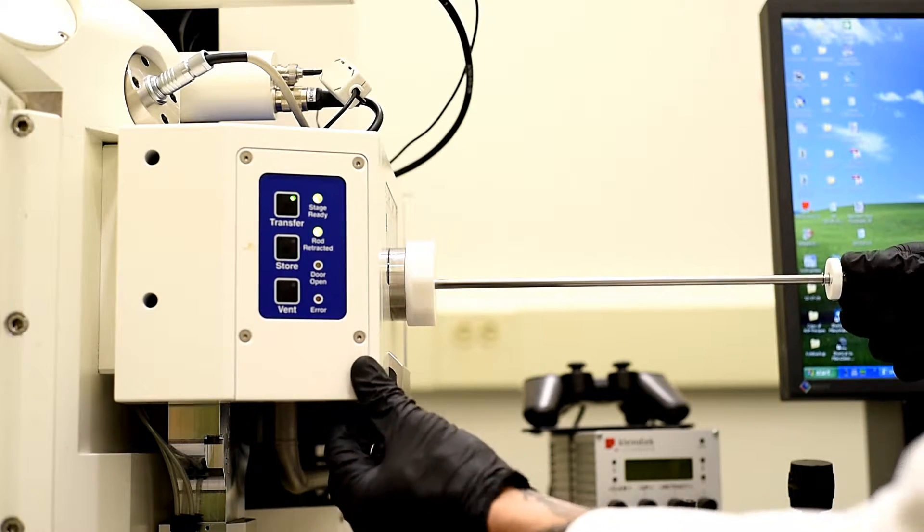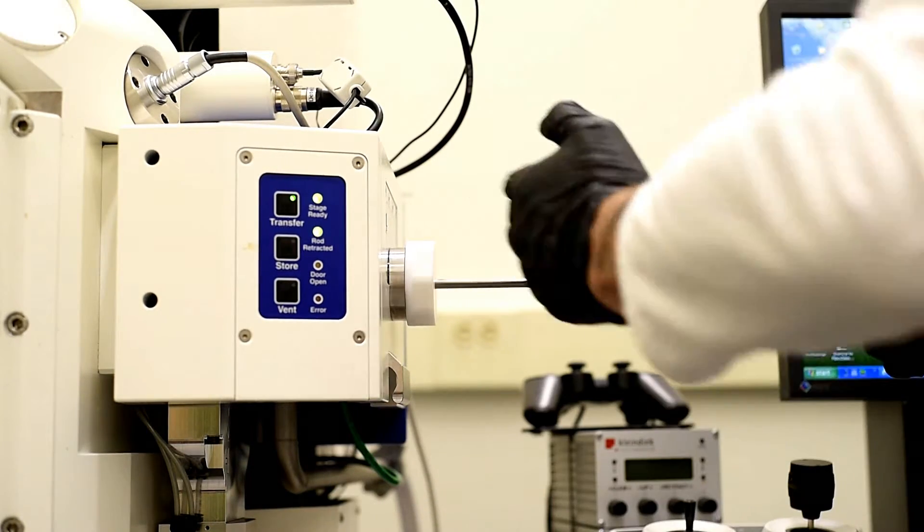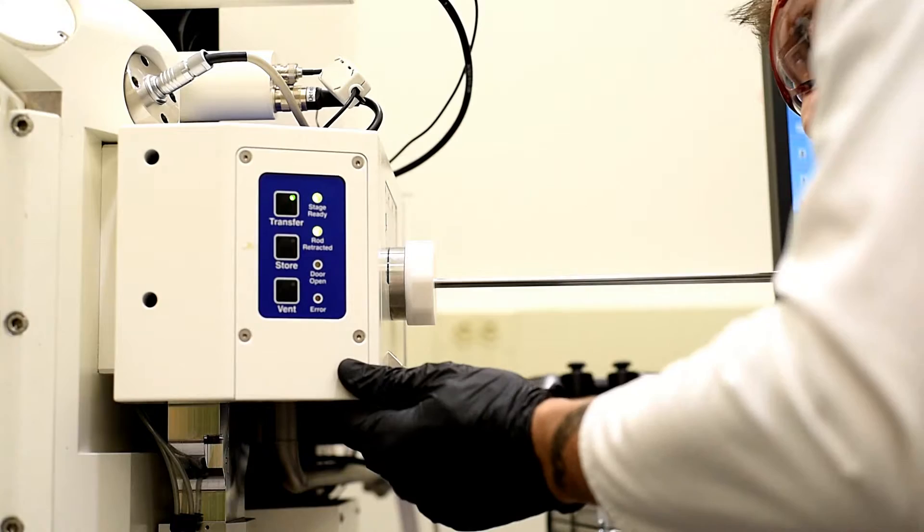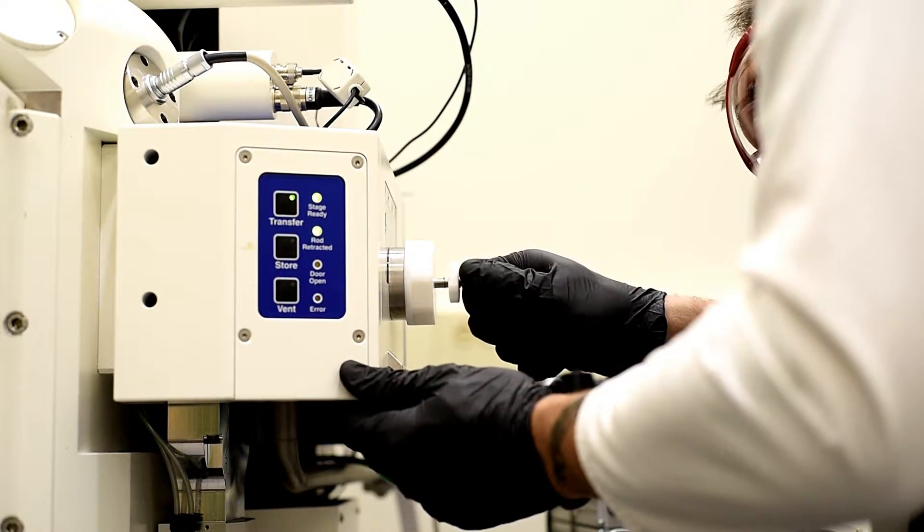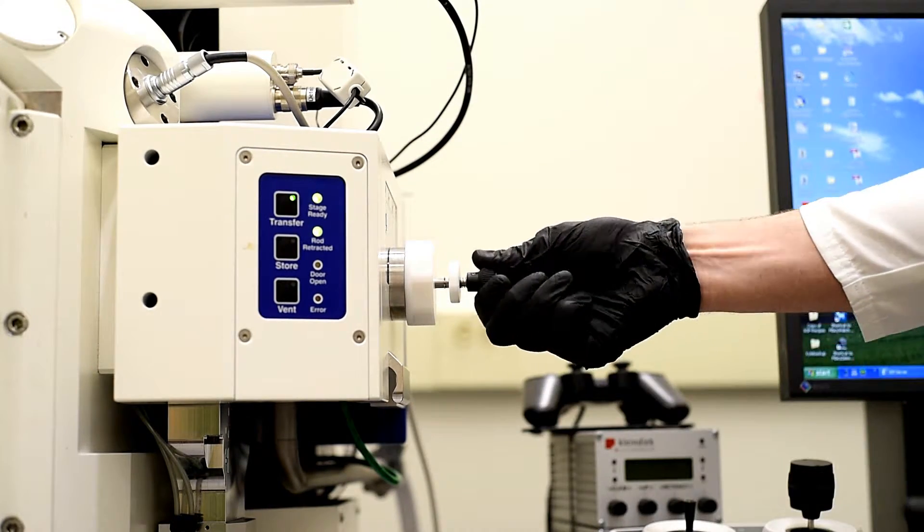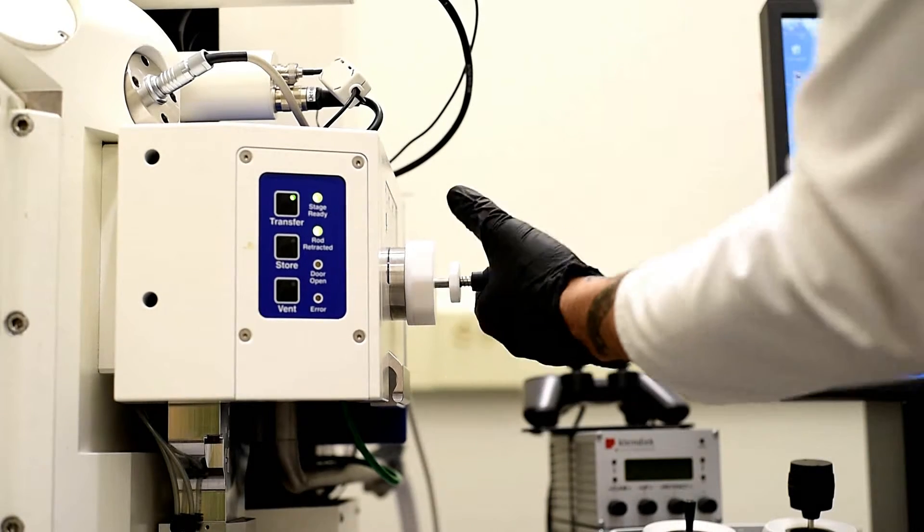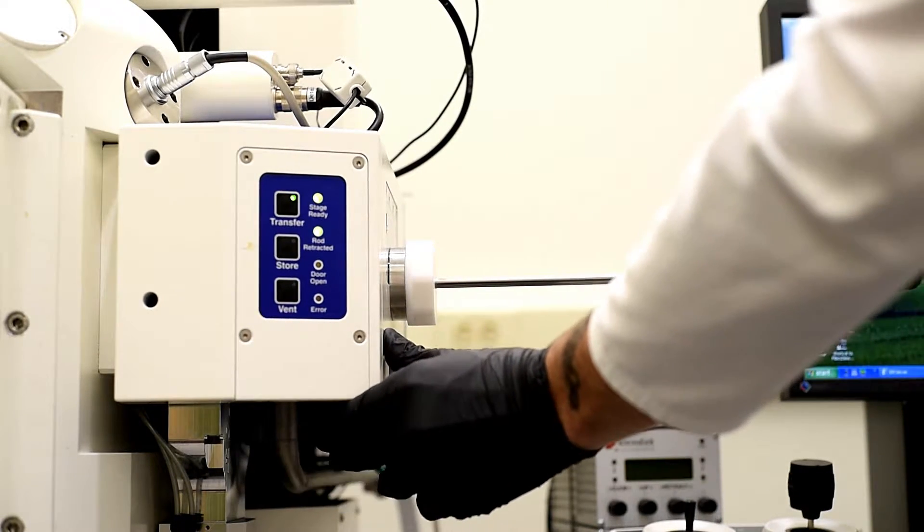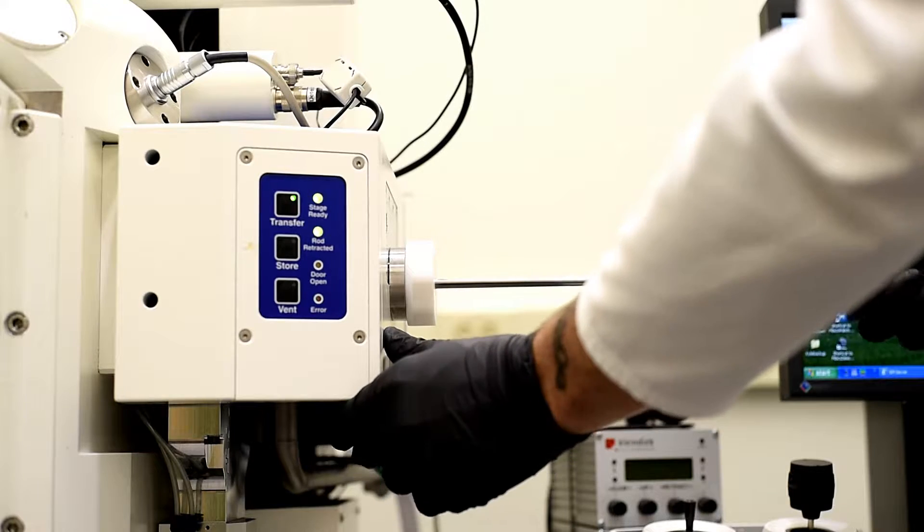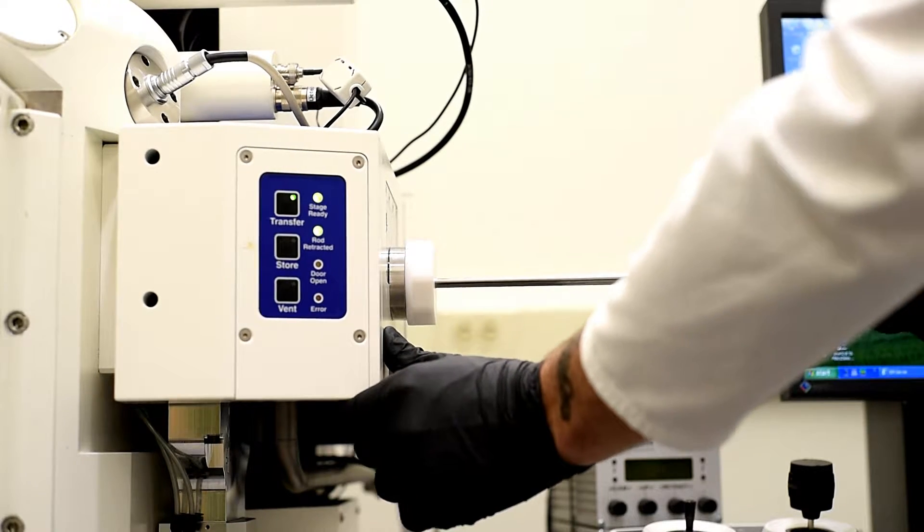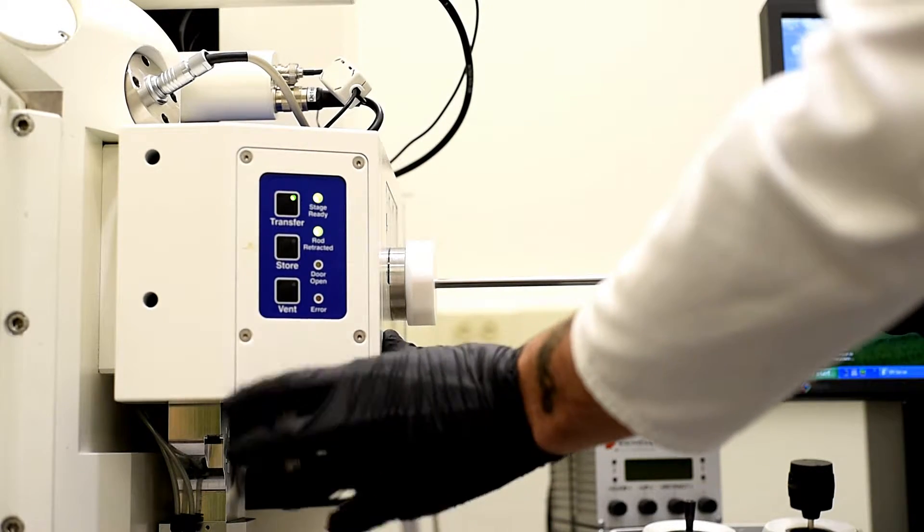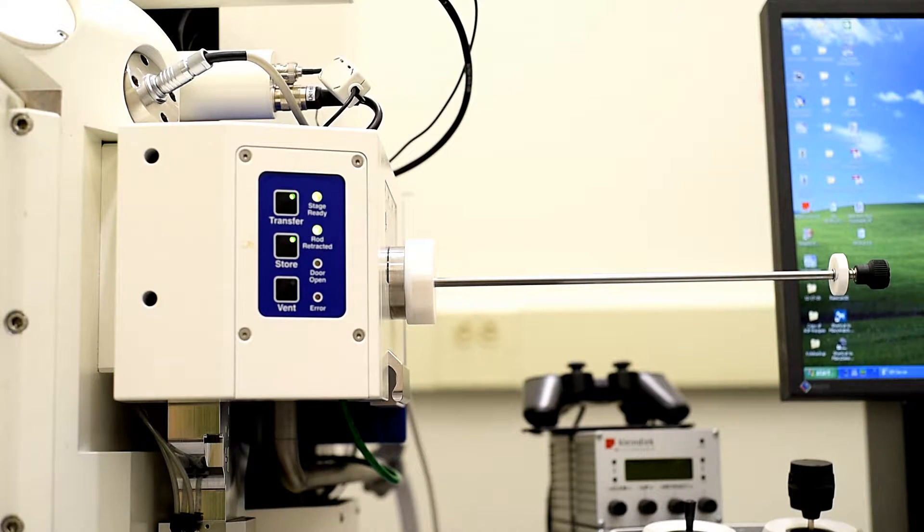So now I just use the arm and I go, you can actually look through this window which you can't see, but we can go from island A to B and now unscrew it or screw it to the left hand side and pull the arm back. And there's a safety click, you'll feel it with a click to keep it in place. And now we can hit store to drop the door back down.